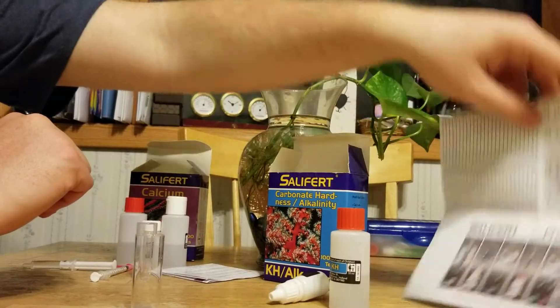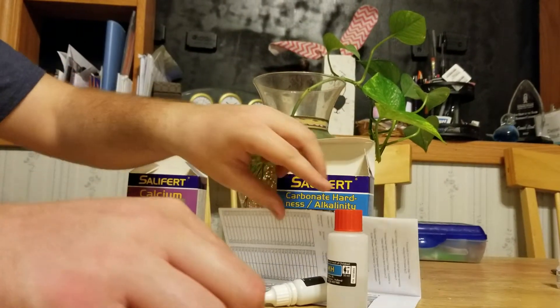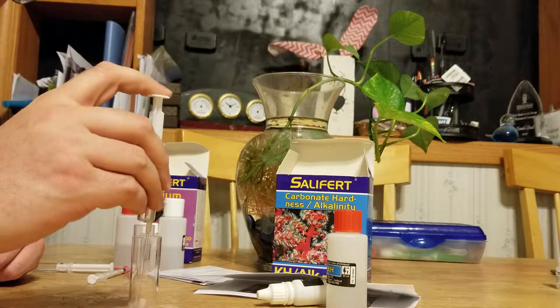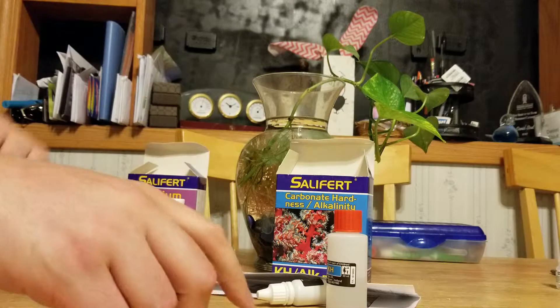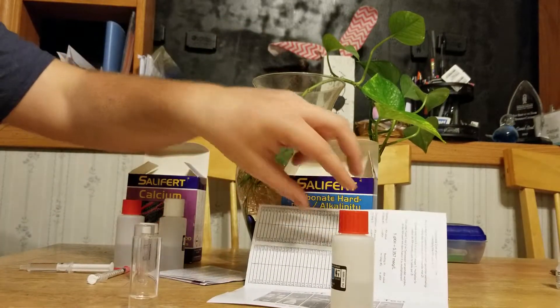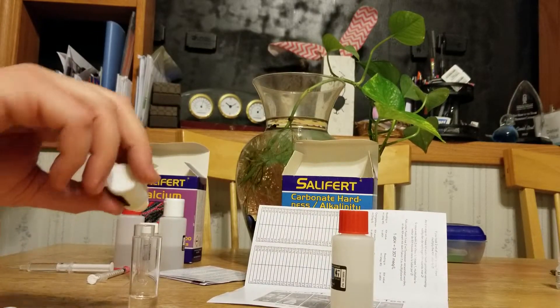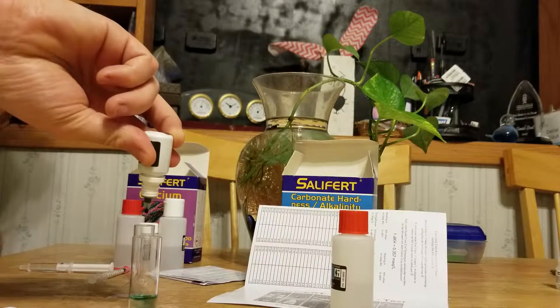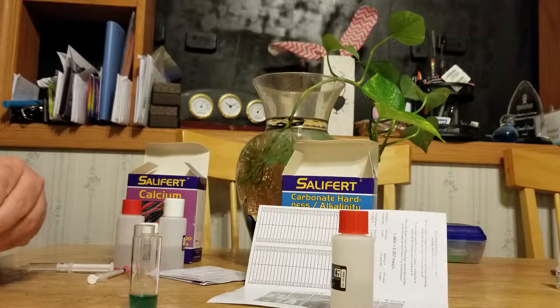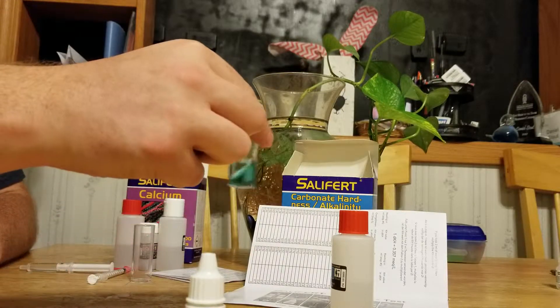It tells you to start off with four milliliters of water, so we got that — dump that in. Solution number one tells you to put in four drops: one, two, three, four. Then it tells you to shake it for about five seconds, so let's give it a nice spin.